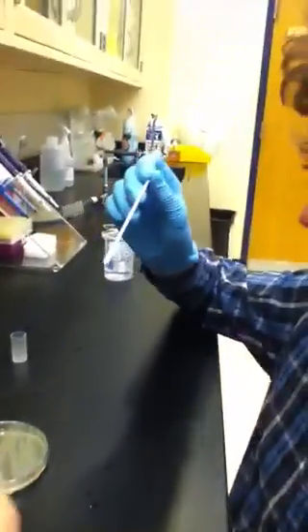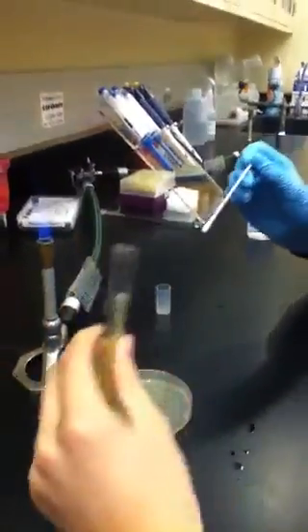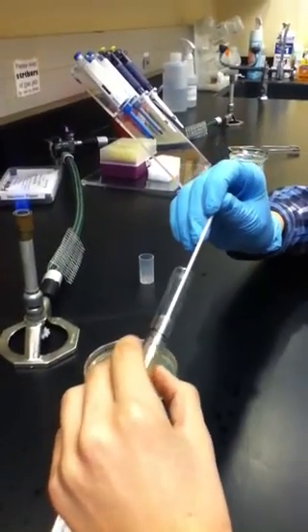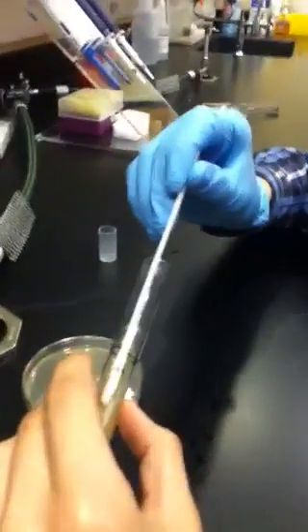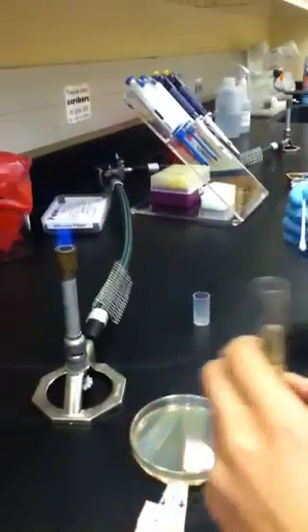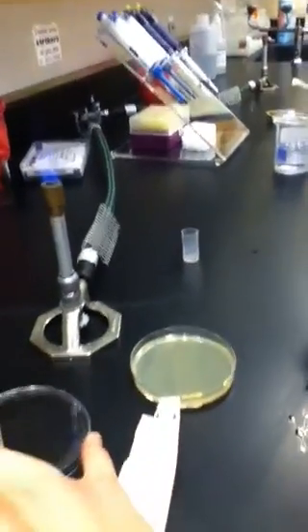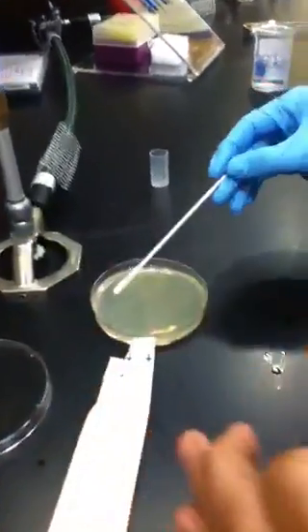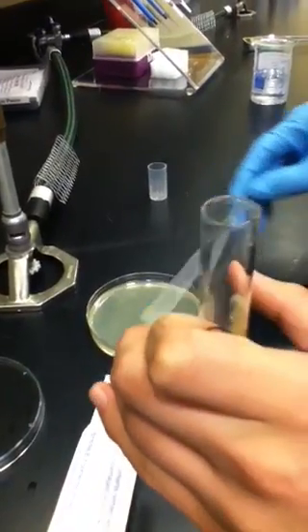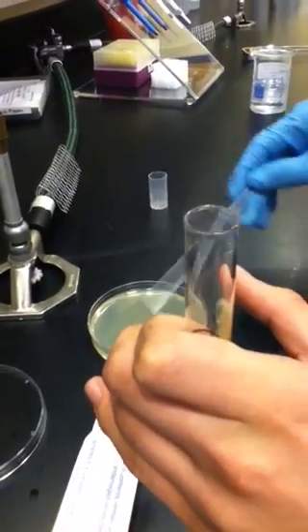Here's a sterile swab. Going to flame it and then put it in and take a bunch of bacteria — see? Taking bacteria, and then I'm going to open this and start spreading my bacteria all over the plate.